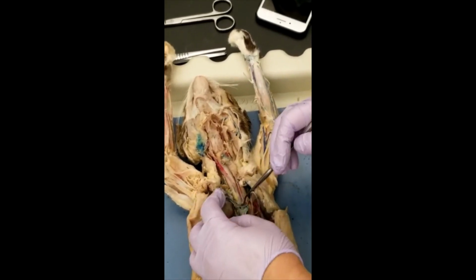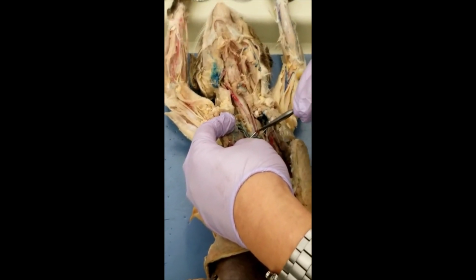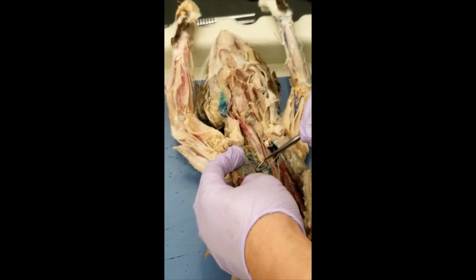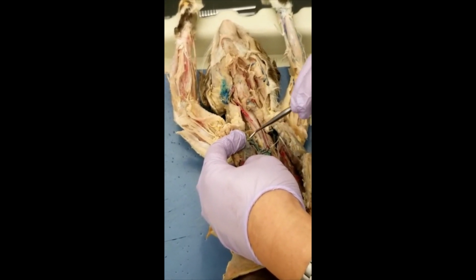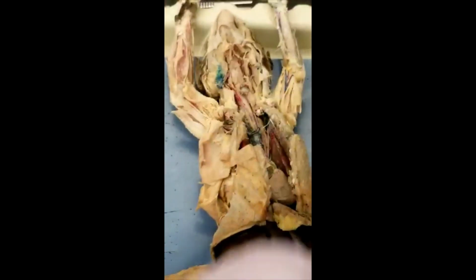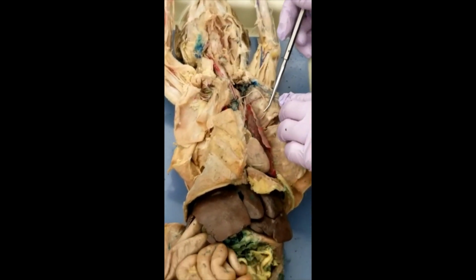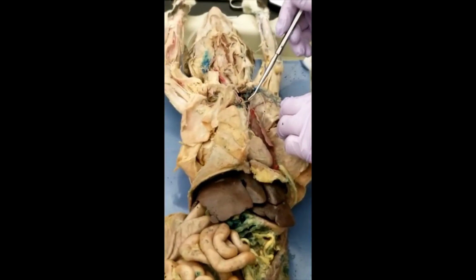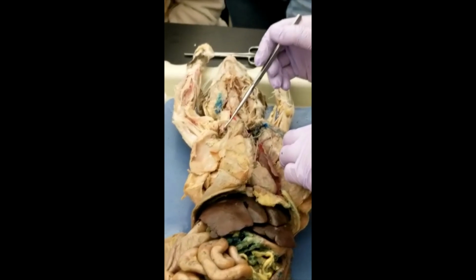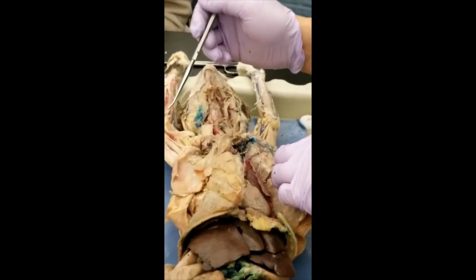Just see where it branches. Before the branch, superior vena cava. The first branch, brachiocephalic. Brachiocephalic branches again into subclavian and external jugular. Every time it branches, the name changes. So is it left and right? Yes. Left brachiocephalic, right brachiocephalic; left subclavian, right subclavian; left external jugular, right external jugular.